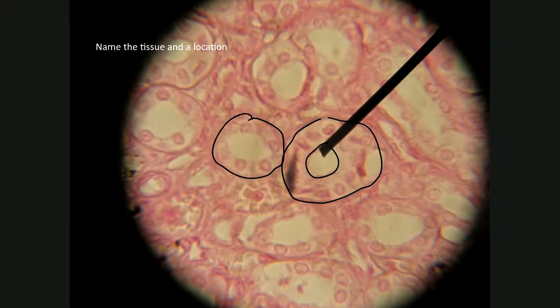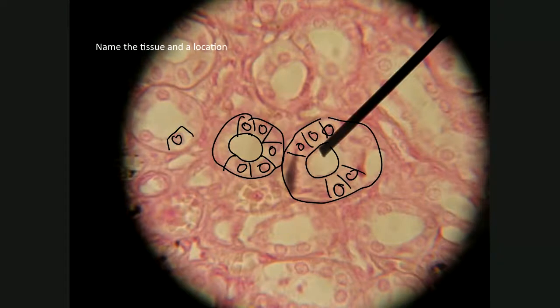And these will be the nuclei of cells, which means that the cytoplasm of the cell membrane is right there. Another nice little nuclei, another nice little nuclei. So you see here round nuclei. Round nuclei suggests square cells. So you can see how these are little square cells, single layer of cells, because the tissue in between is connective tissue. So these right here will be connective tissue, connective tissue, connective tissue. And in between these little circular structures, we have this connective tissue separating these single layers of cells.